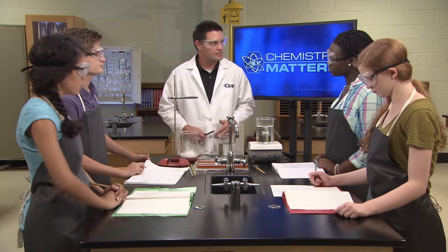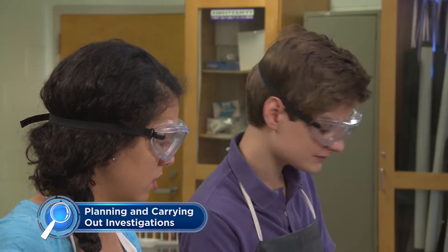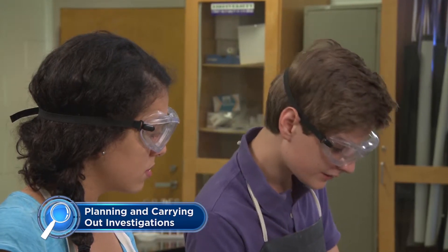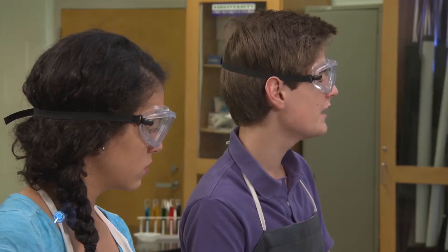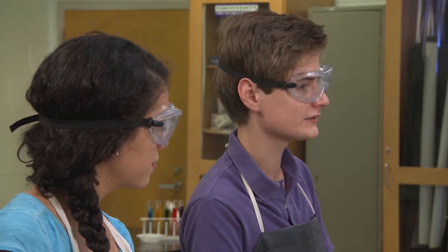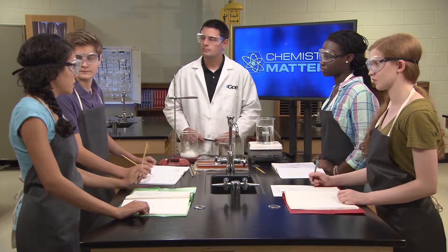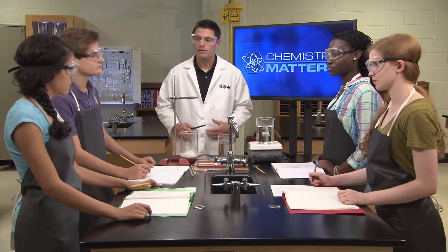So let's review our procedures for the lab. We plan to put a tube of gas mixture in dry ice at minus 79 degrees Celsius, another in room temperature at 25 degrees Celsius, and a third one in hot water at 100 degrees Celsius. We'll use a thermometer to test each one, then compare the color of the gases in each tube at the different temperatures.